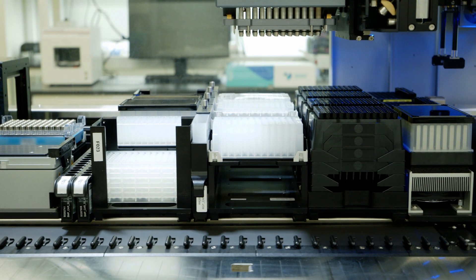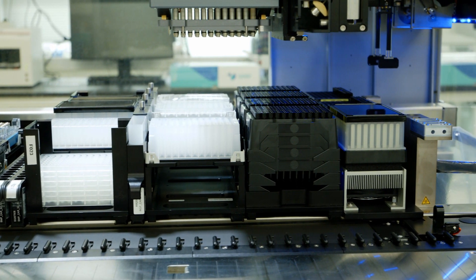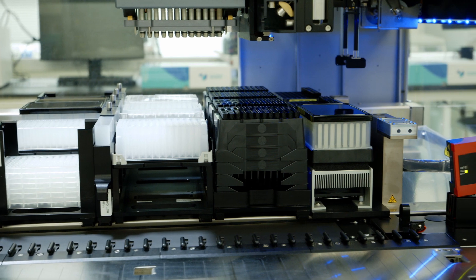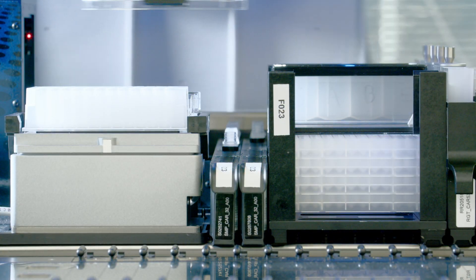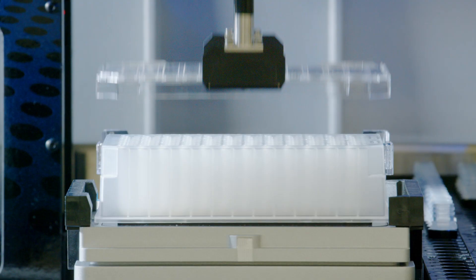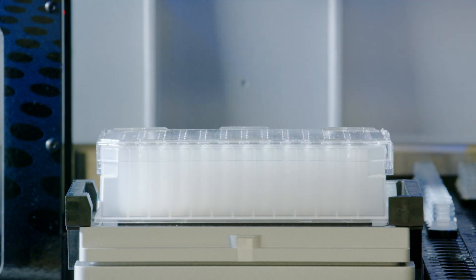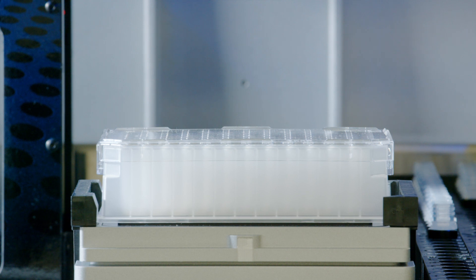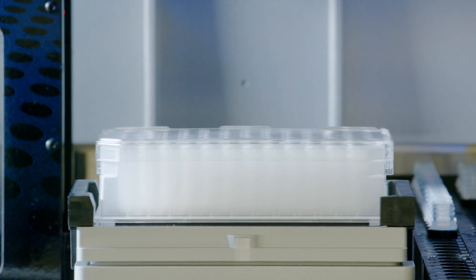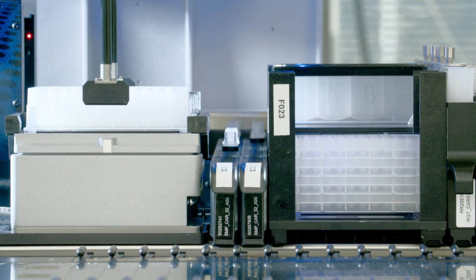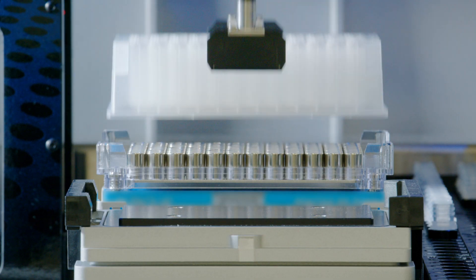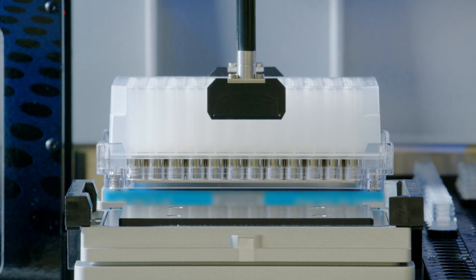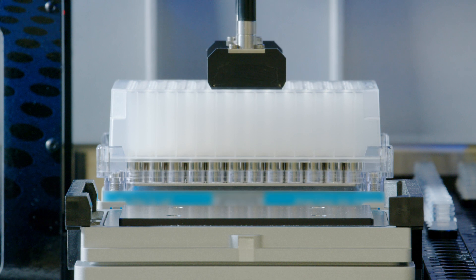The work deck contains the major hardware components. The work deck includes a heater shaker, which is used for incubation and continuous mixing of the sample prep plate. The work deck also includes the magnetic plate, which is used for purification and peptide transfer from nanoparticles.